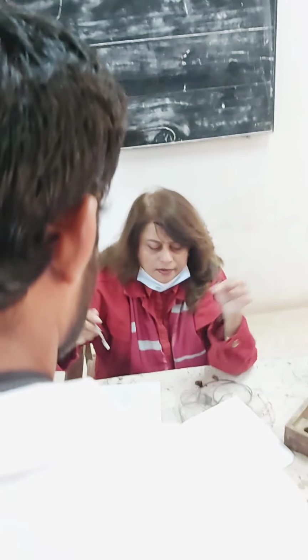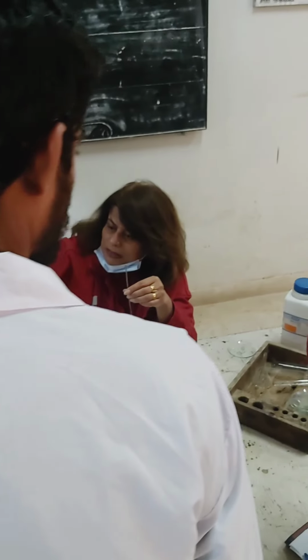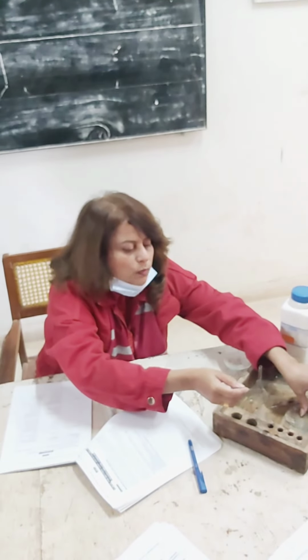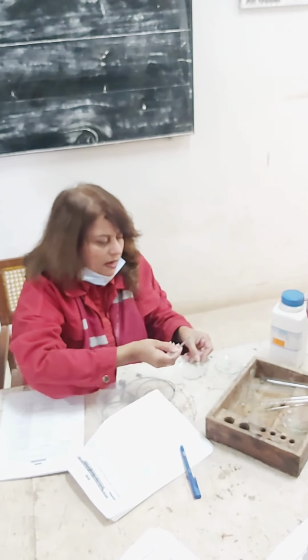For stirring you need a glass rod, which is not here. Glass rod you will be needing, but you will not stir the compound, right? You will only take out a few granules from here and add them to your test tube, right? And then you are going to perform it in the way it is supposed to be. जो भी आगे से होगा, we are going to practice. So now करना क्या है?